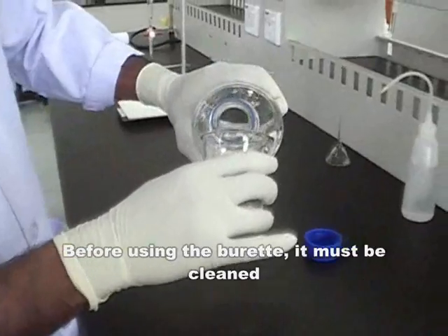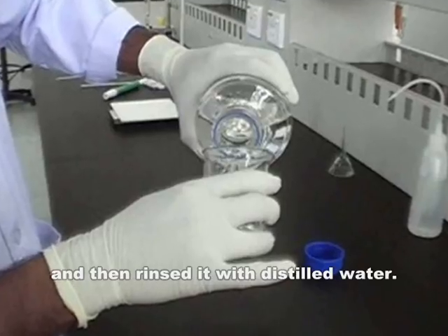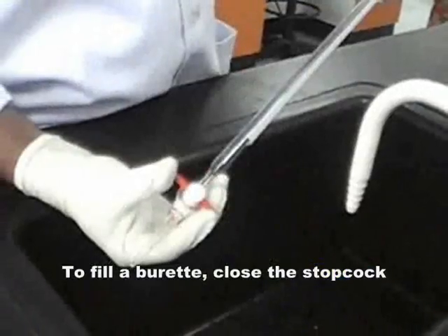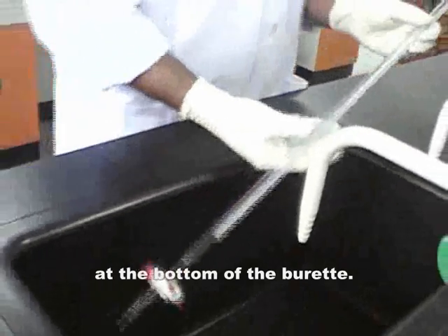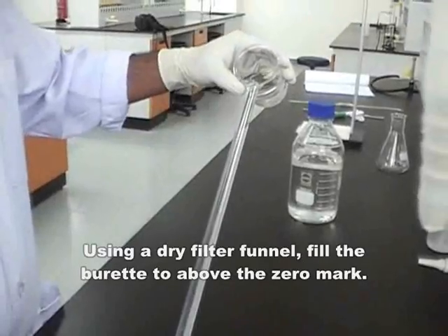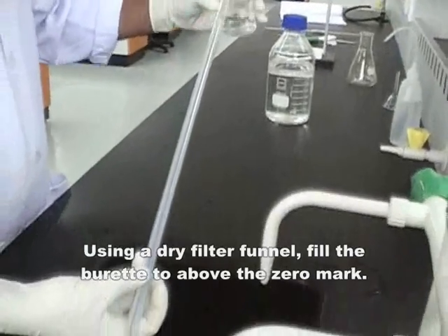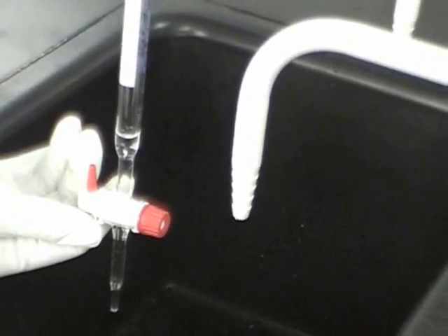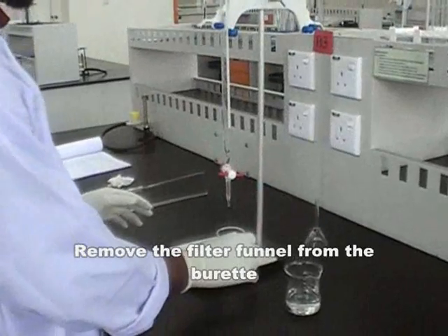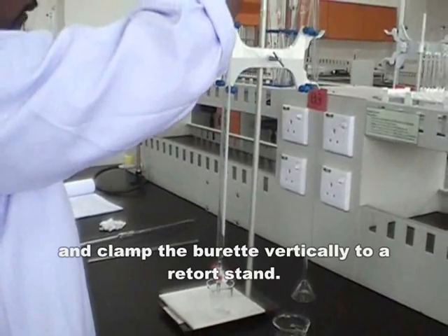Before using the burette, it must be cleaned and then rinsed with distilled water. To fill a burette, close the stopcock at the bottom of the burette. Using a dry filter funnel, fill the burette to above the 0 mark. Remove the filter funnel from the burette and clamp the burette vertically to a retort stand.